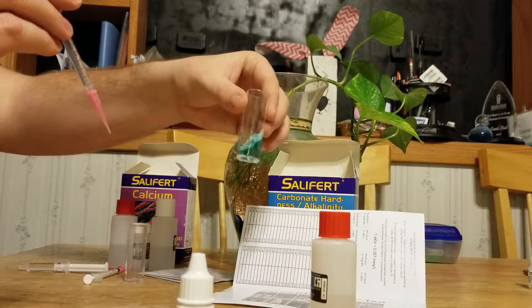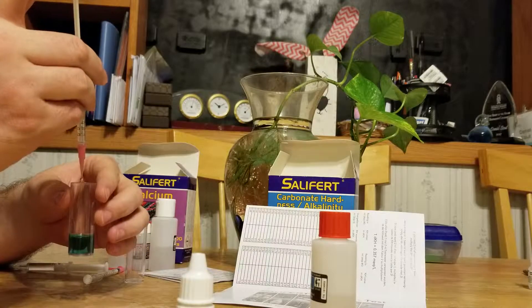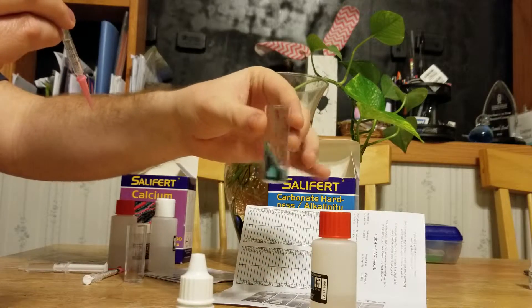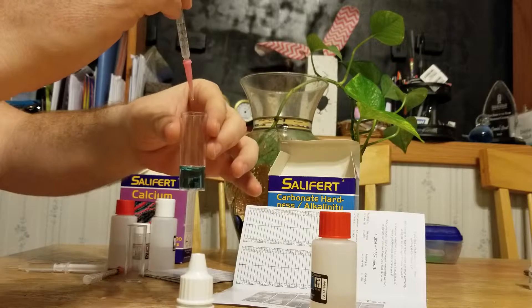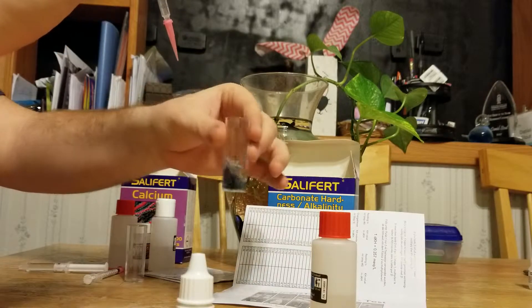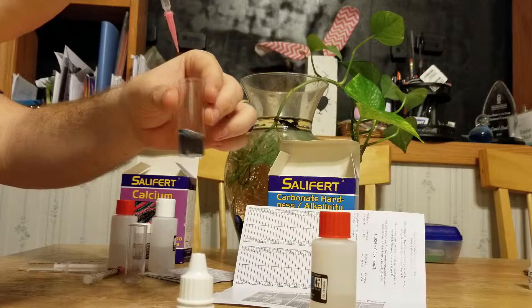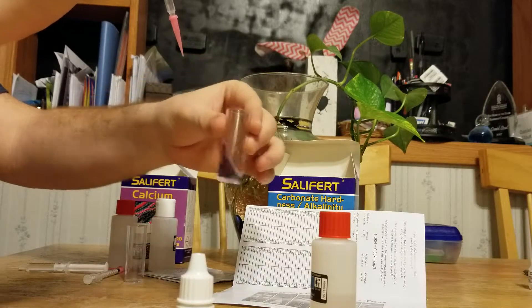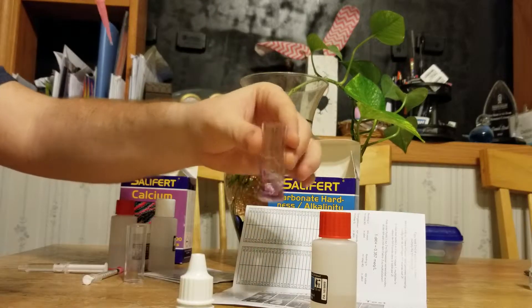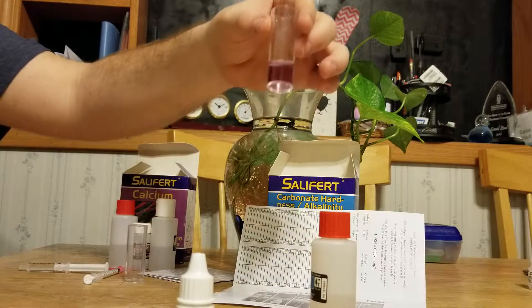You're gonna go from blue to pink. I know about where I should be since I've been testing pretty regularly, so I'm gonna add in quite a bit and then give it a nice shake. I stopped just before — keep that nice blue color — then add drop by drop, swirl. Drop, shake. Drop, shake. One more drop... one more drop. And there's the color change — we went from blue to that pinkish color.